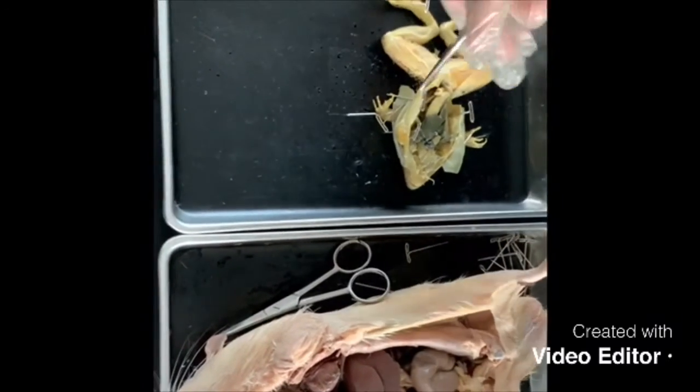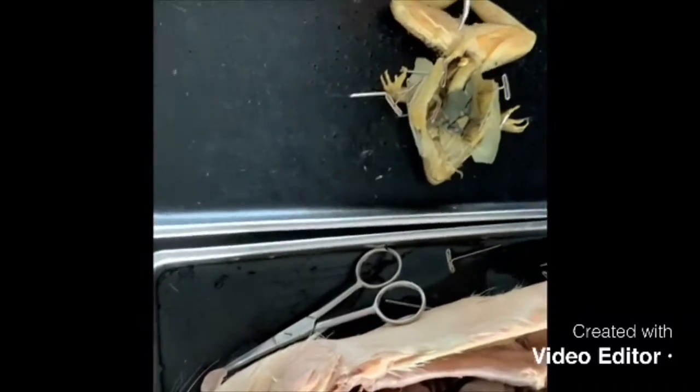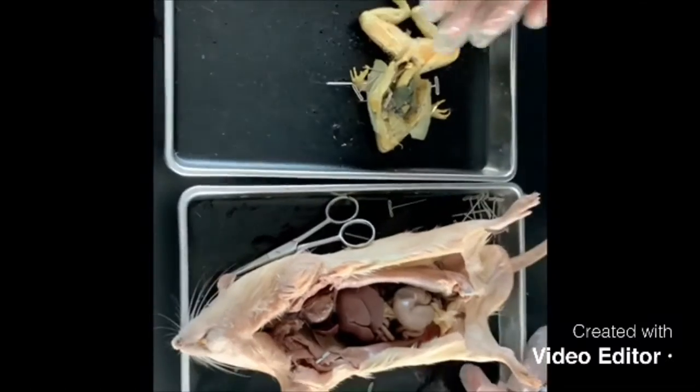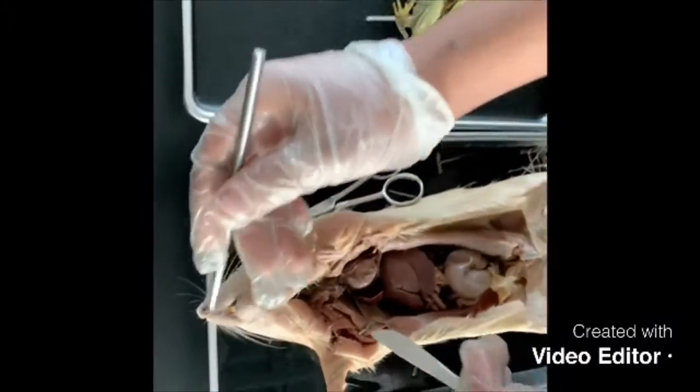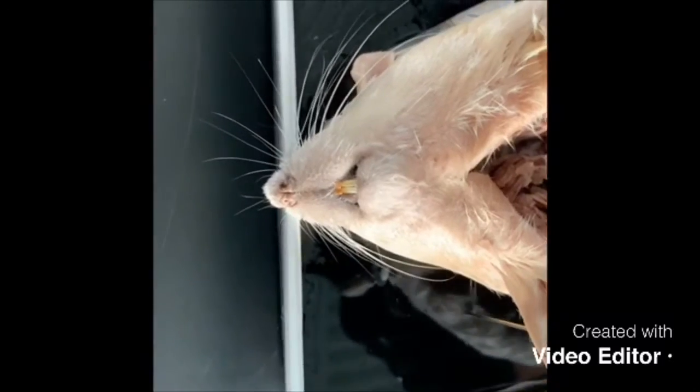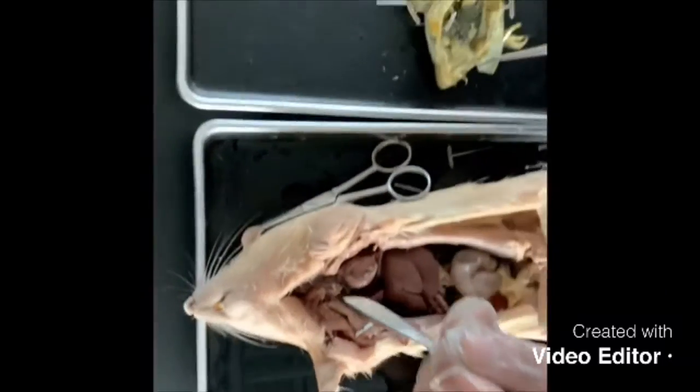Moreover, the frogs inhale through their nostrils, inflating the skin sacs in the throat, and then press the air into the lungs. And then the rat uses its nostrils and its mouth to allow the air into the lungs, which is connected to a trachea in both animals, which is visible.